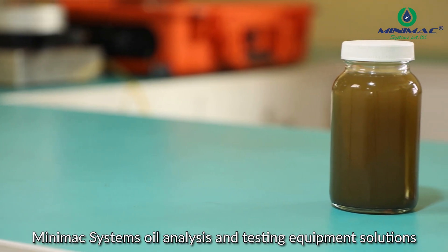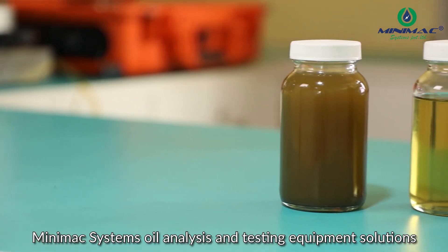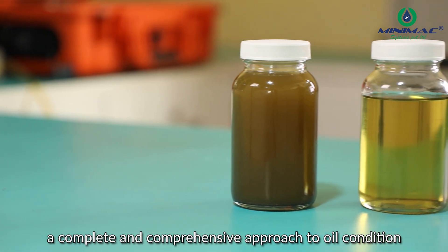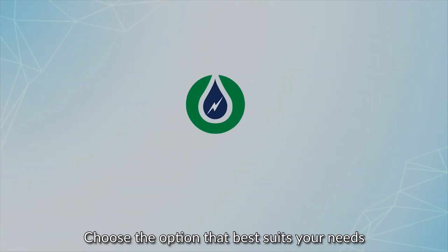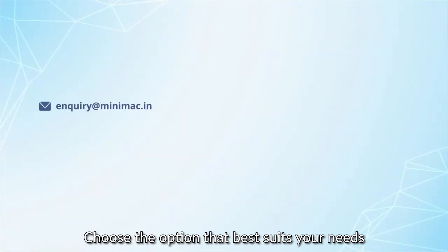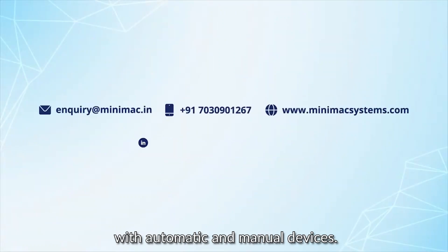Minimac Systems oil analysis and testing equipment solutions provide a complete and comprehensive approach to oil condition monitoring and analysis. Choose the option that best suits your needs with automatic and manual devices.